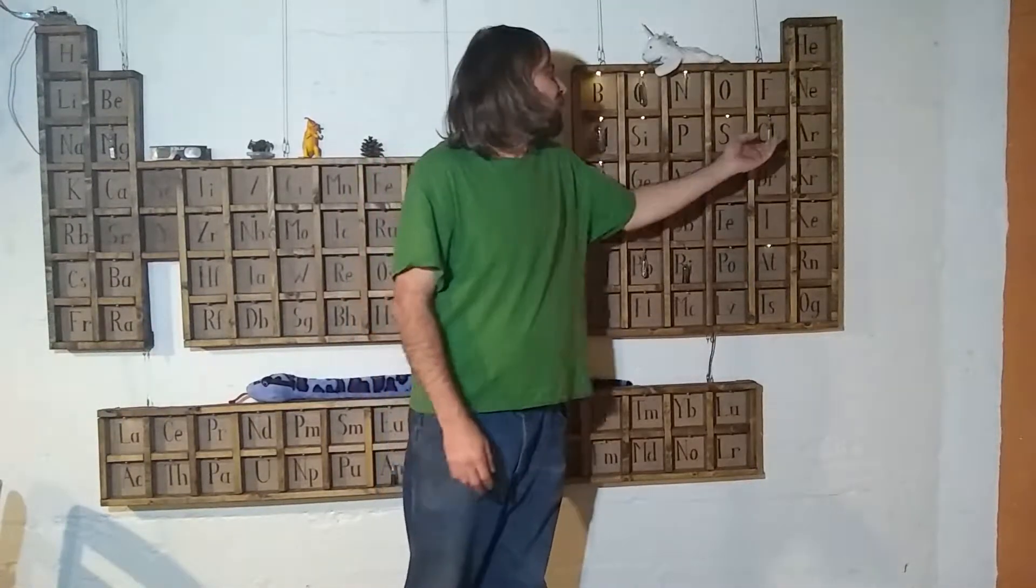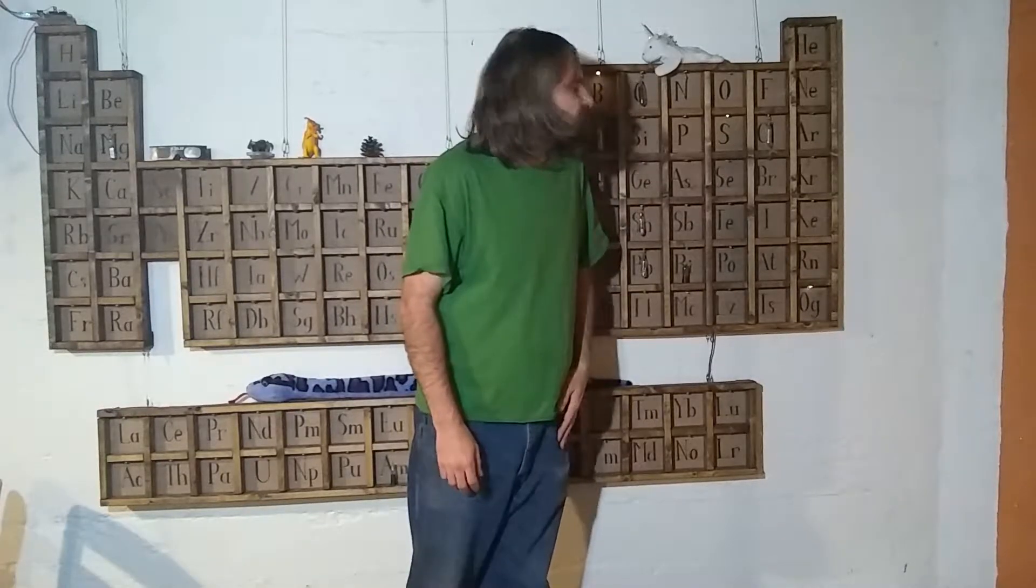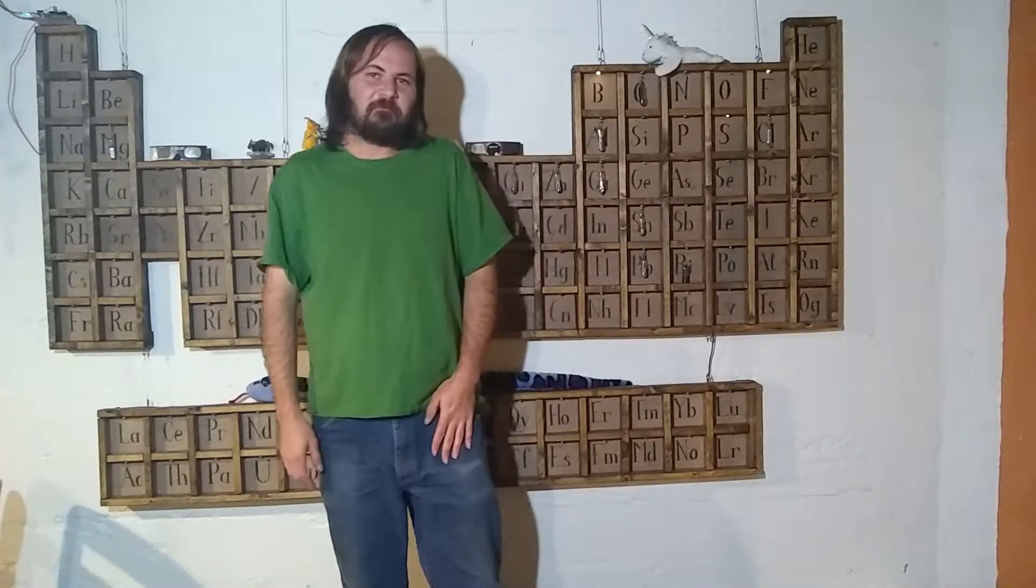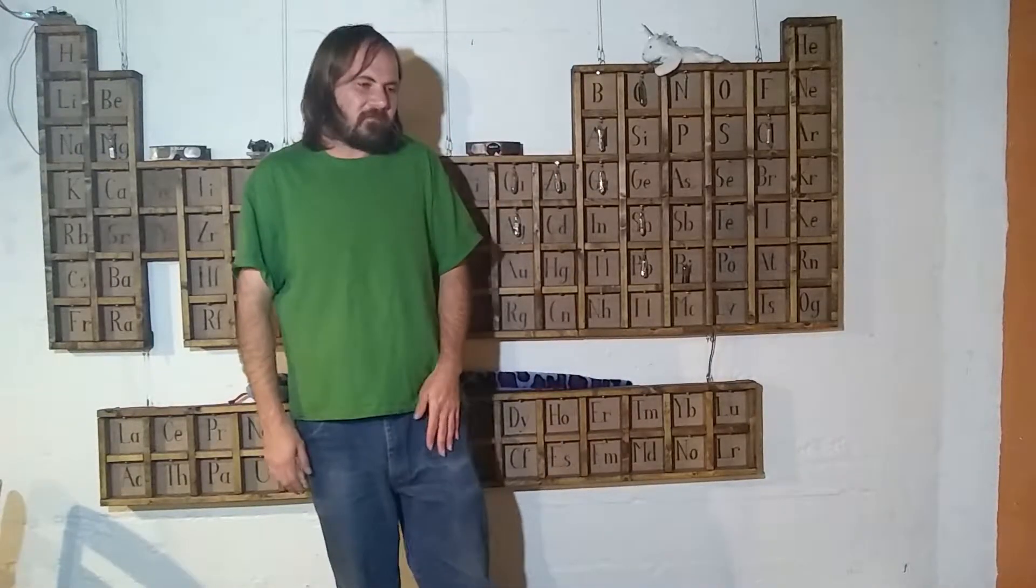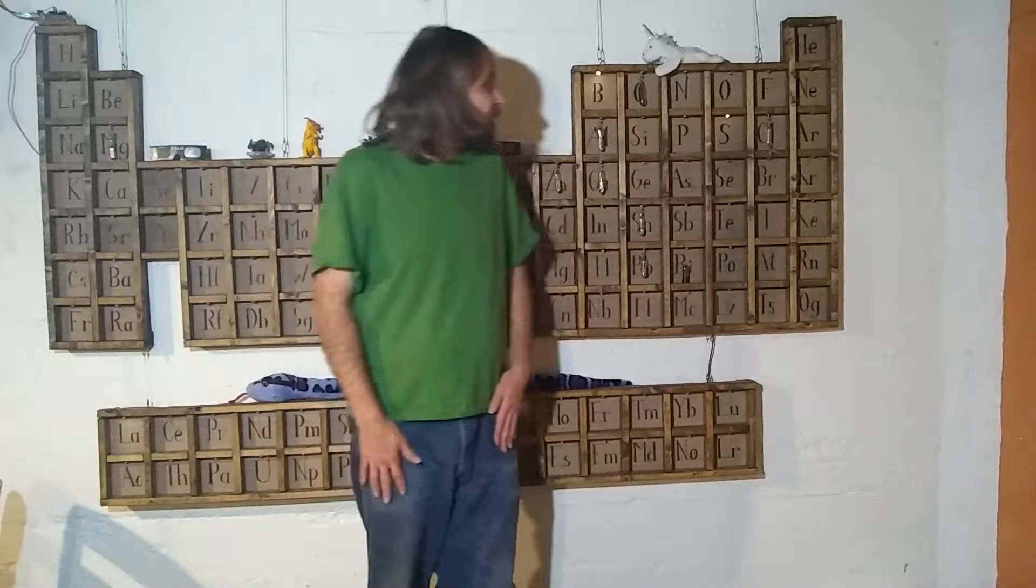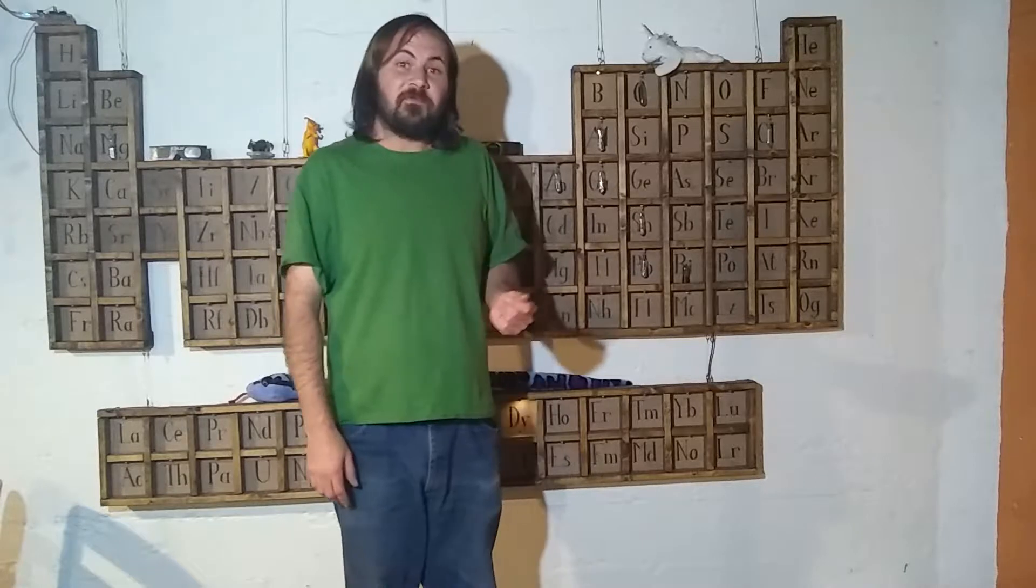Well, it would have been a very nice sample of chlorine had it not cracked. And it would be sitting there being all yellow and green instead of being all transparent. But it gives me a good reason to do an episode sometime in the future after I can afford to buy another box of test tubes. And I'm going to redo some of my element samples that didn't turn out quite the way I wanted them to.